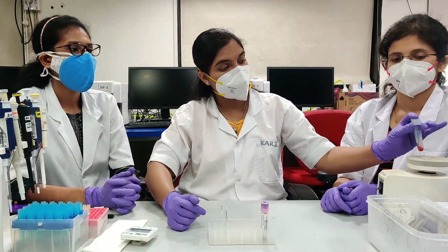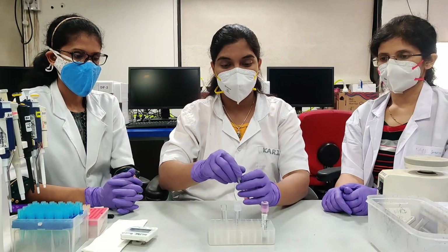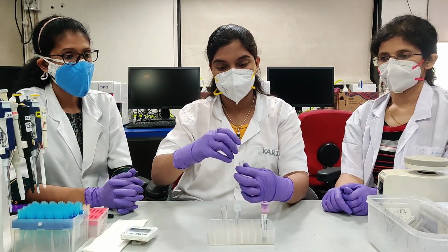Incubation is over. Vortex the tubes. Add 2 ml of 1x lysing solution to both the tubes.